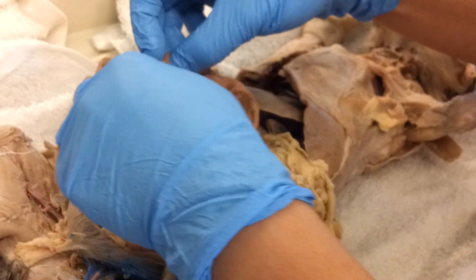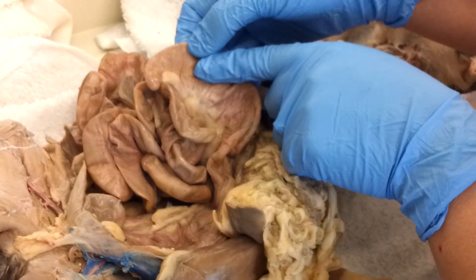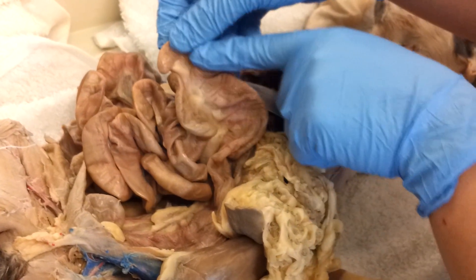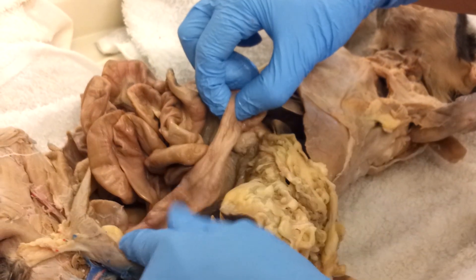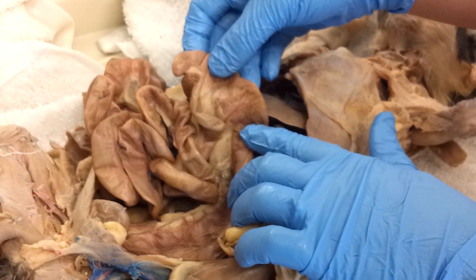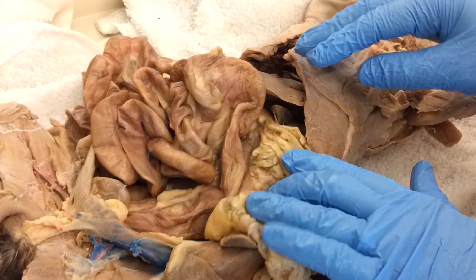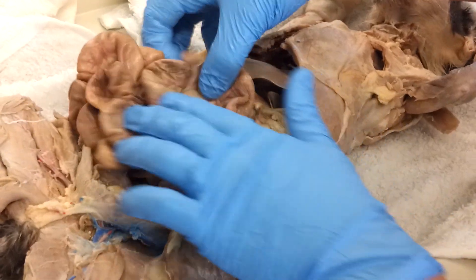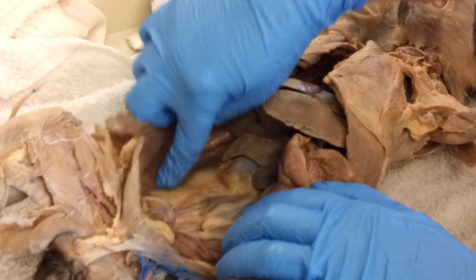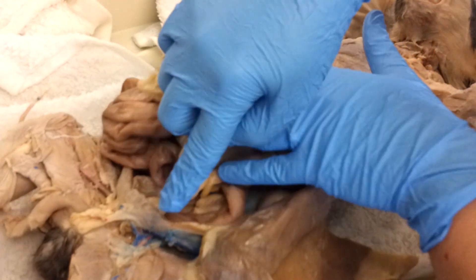In the cat, the colon is shaped sort of like the start of a question mark, or some people say it's shaped like a C. It starts here and then ends right here at the rectum. It's much shorter than the human colon because a cat is about as close to a pure carnivore as you can find, and humans have the colon of an omnivore, so ours is longer. Another big difference is that the cat's colon is not retroperitoneal — see how I can pull it away from the body wall. A human's colon is attached to the back of the body wall, ascending, then transverse, then descending, then sigmoiding, then to the rectum and out the anus.